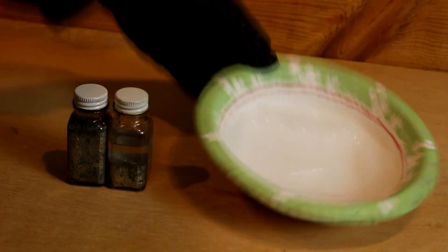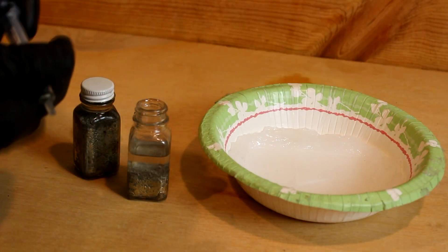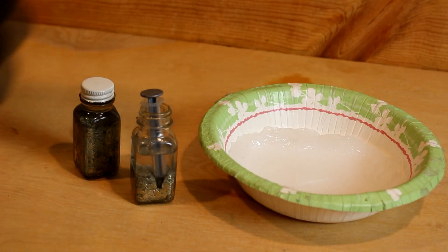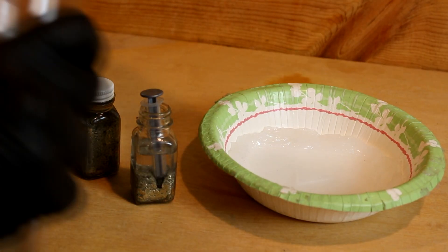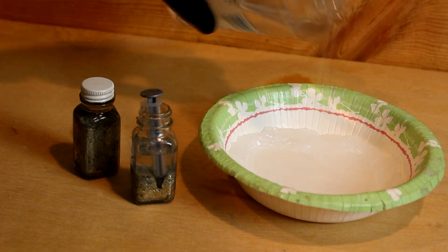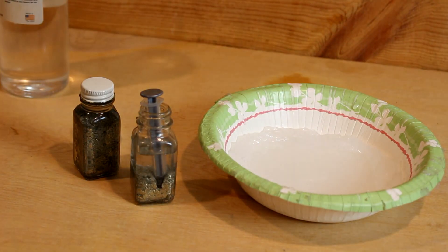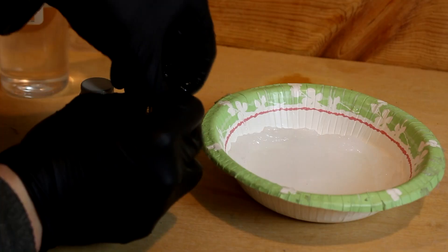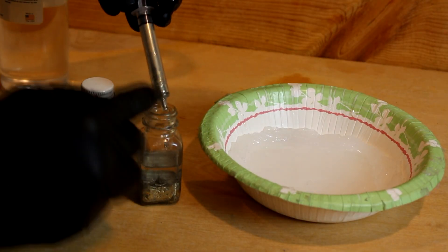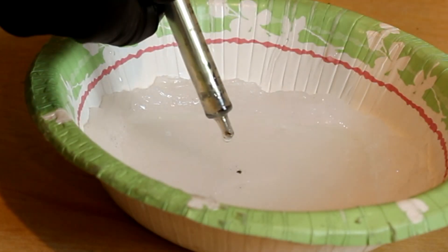So here's the play button mold and here's the cesium I've produced. Let's take this cesium out with a syringe. Oh, before I do that, let's actually put some mineral oil on the play button just to keep the cesium from reacting to the air — or maybe even the silicone — because this cesium is just so reactive with everything. Let's pull some of this out. Look at that — pretty. Nice gold color to it. Let's just squeeze it onto the play button.